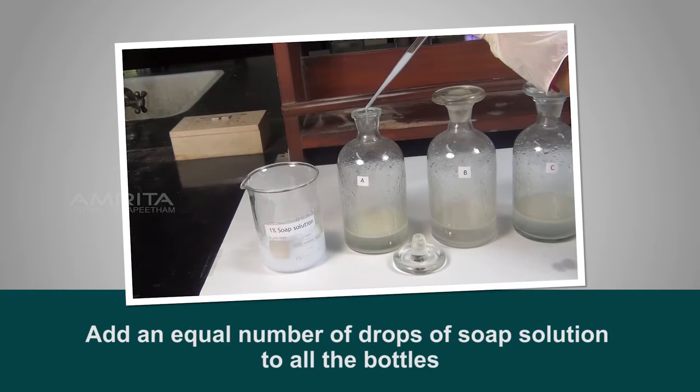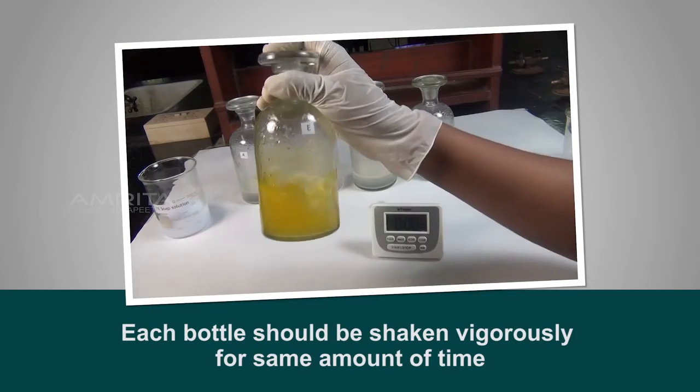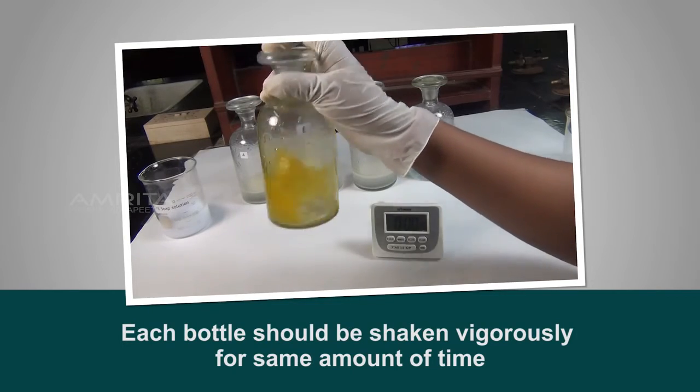Precautions: add an equal number of drops of soap solution to all the bottles. Each bottle should be shaken vigorously for the same amount of time.